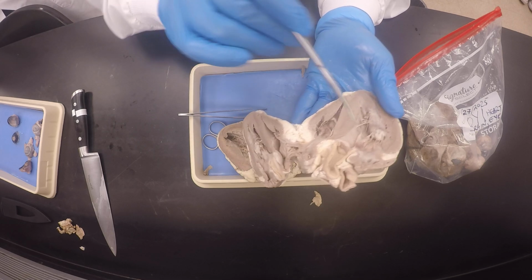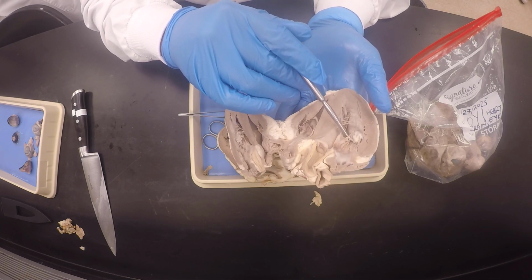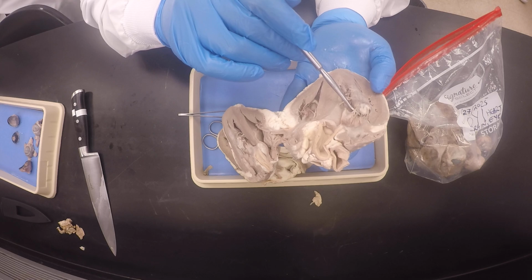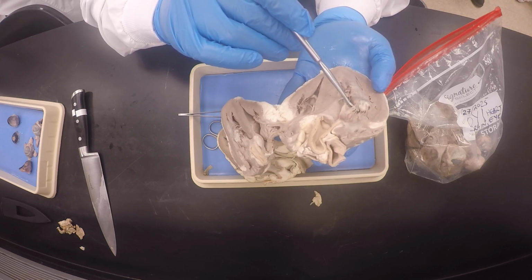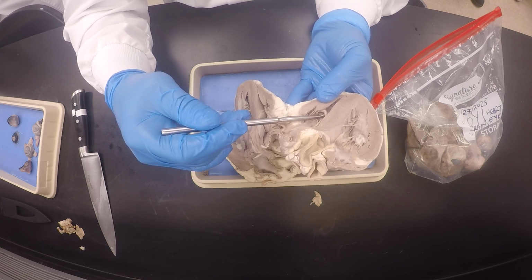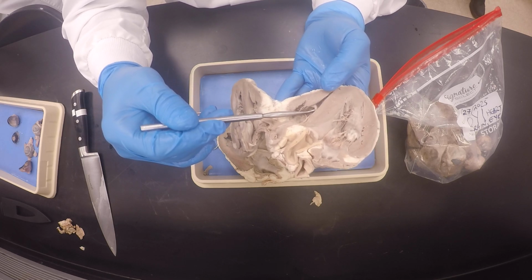You understand? Okay, what are these string-like structures that are connected to the cusps? Starts with a C and is labeled on the board. 2 words. So, chordae tendineae. Again, I'll be like, what are those string-like structures? I might point to 2 of them, and you'll say chordae tendineae, and it's on the board there. And then the other string-like structure is this one, which is much thicker, and there's only one of it. It's on the right ventricle, which confirms that this is the right ventricle. It's the moderator band or septomarginal trabecula.